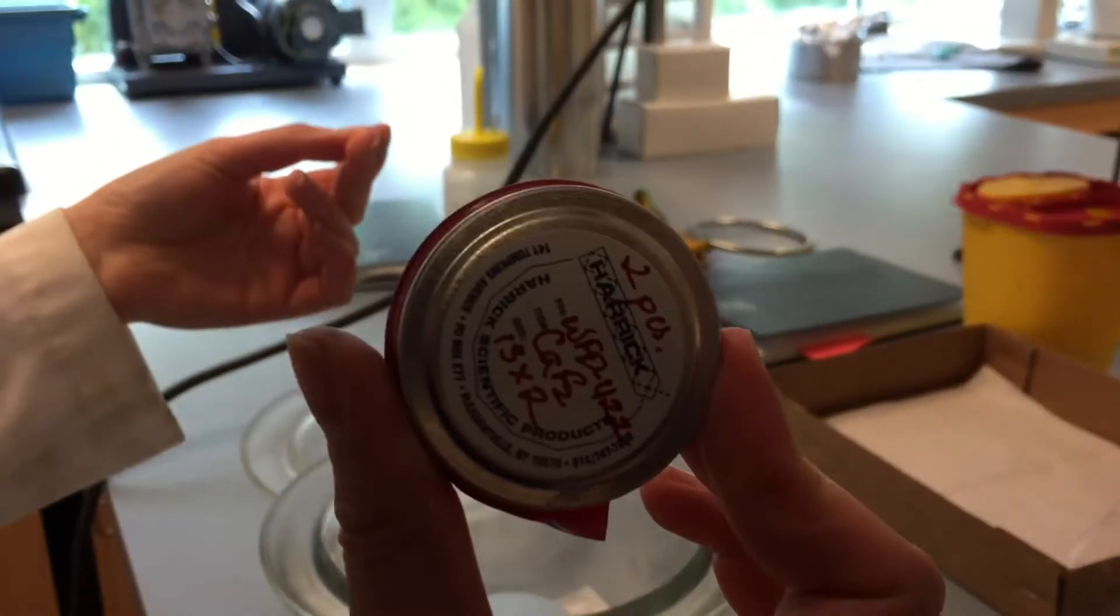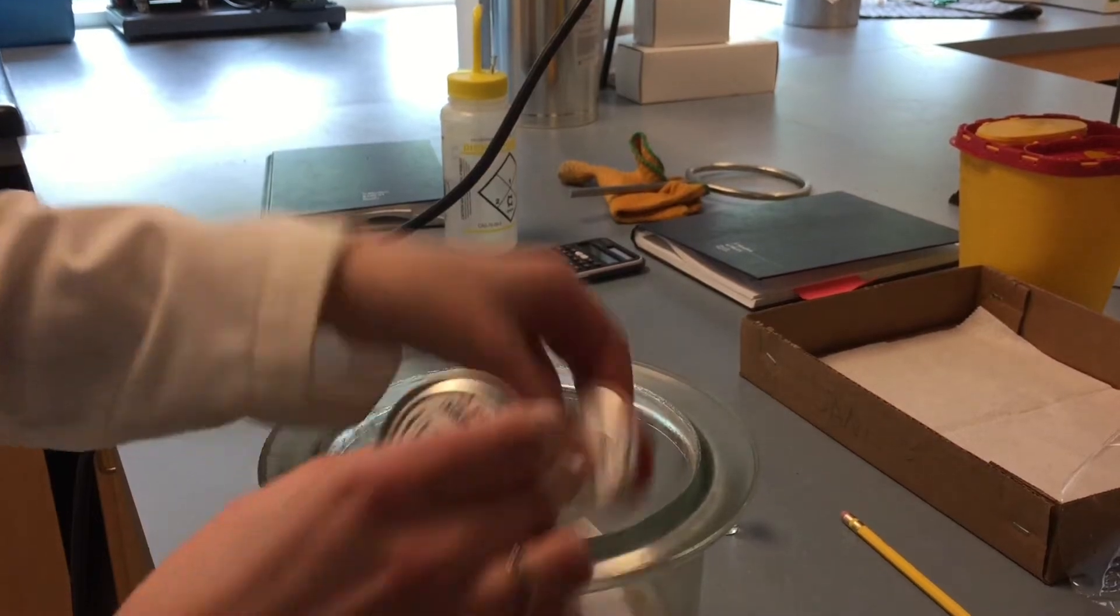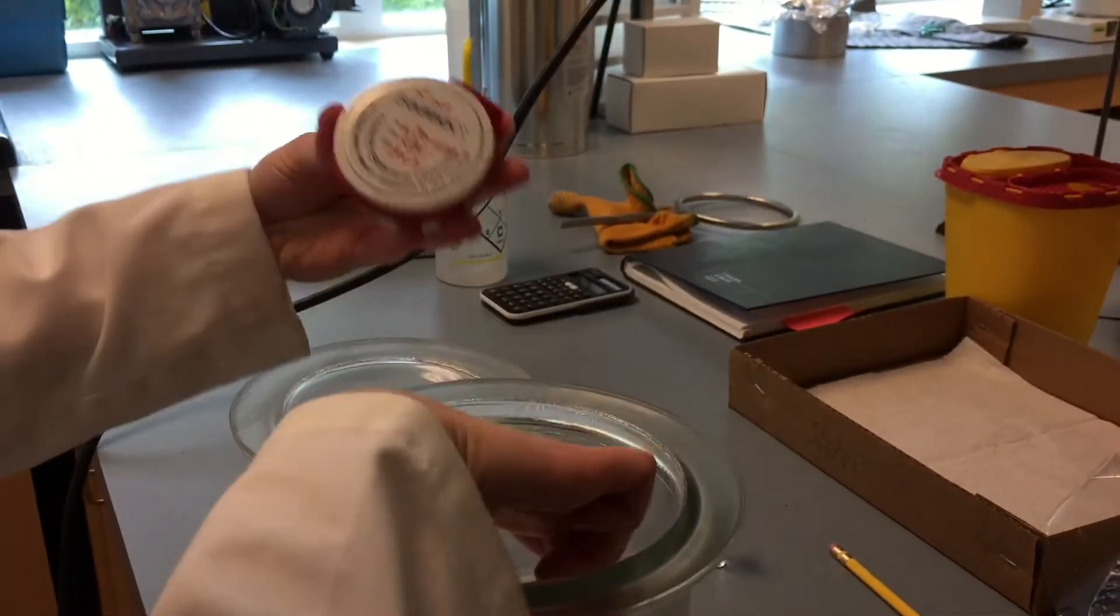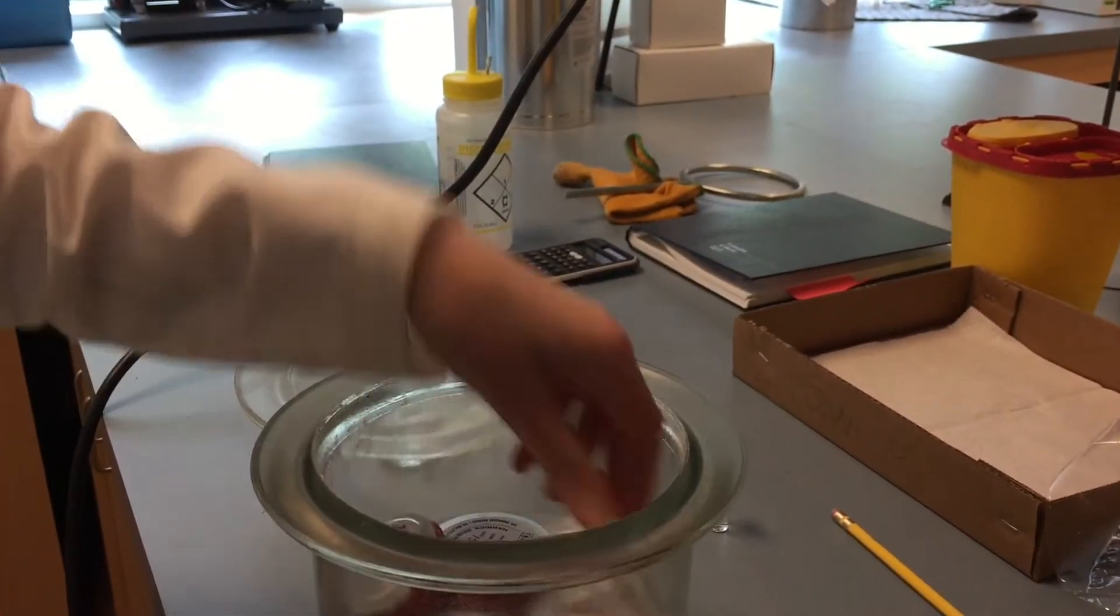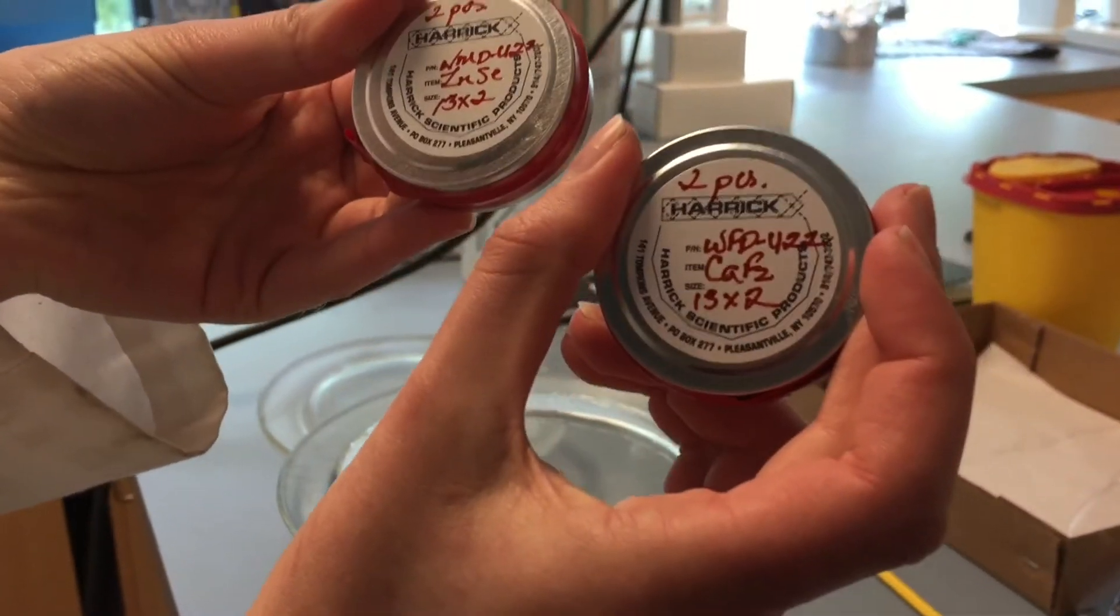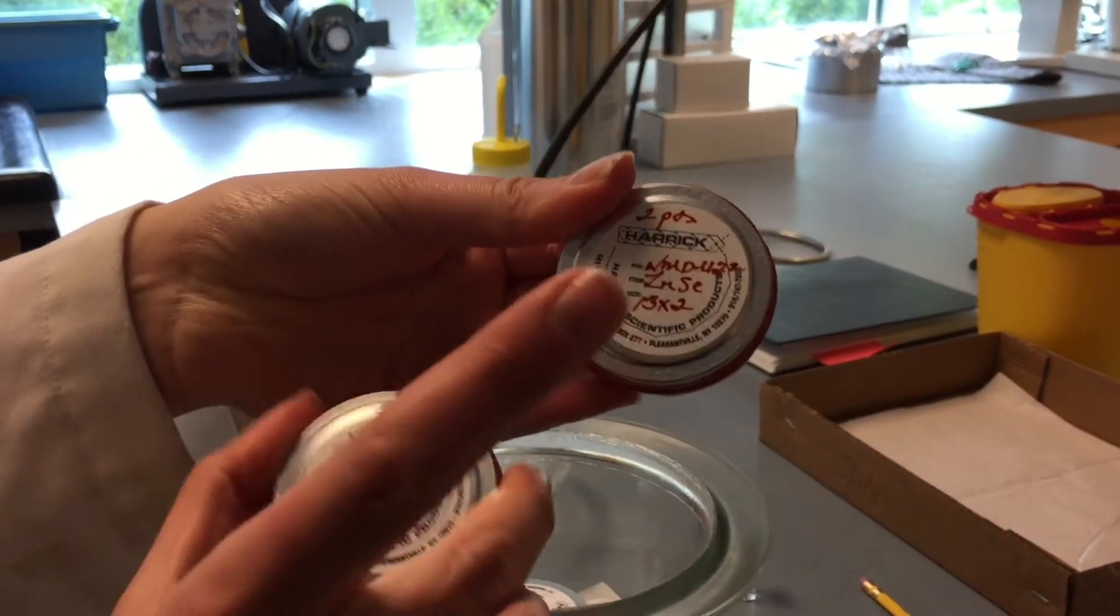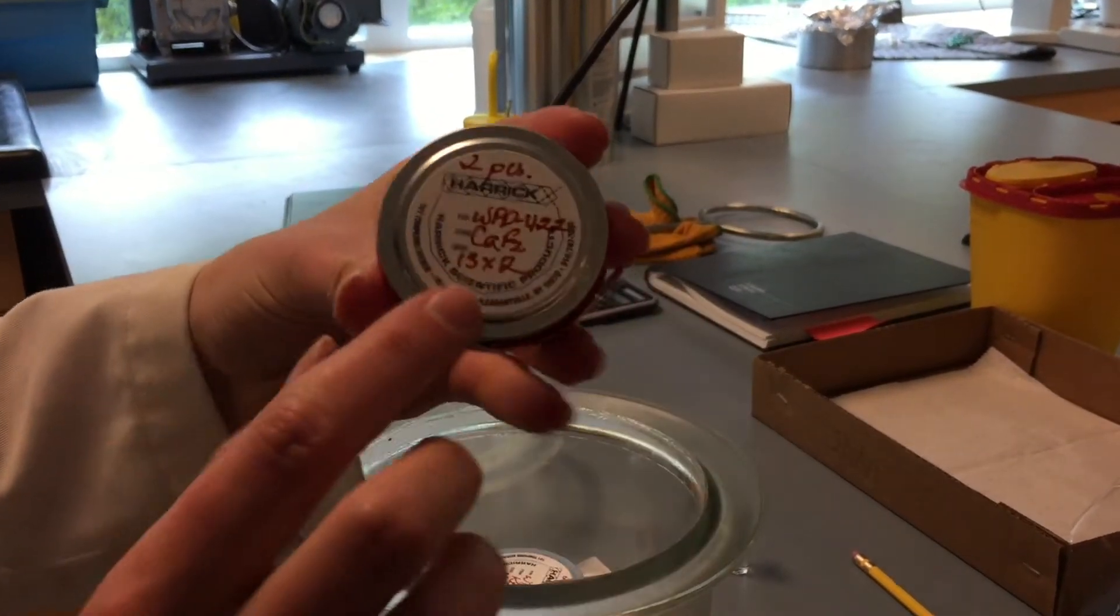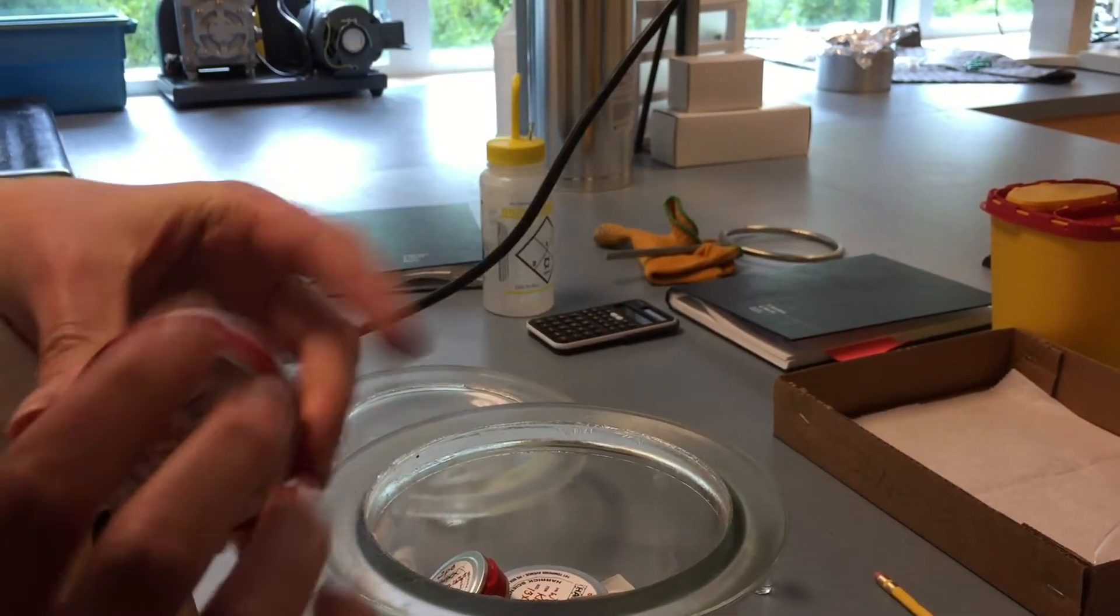These are the containers where these windows get stored in. Here's the barium fluoride container, here's the KBR containers. The other containers are for calcium fluoride and zinc selenide. For the zinc selenide windows, I believe both are in here and they're in working condition. For the calcium fluoride, I think one of them has broken, so you can't use that.